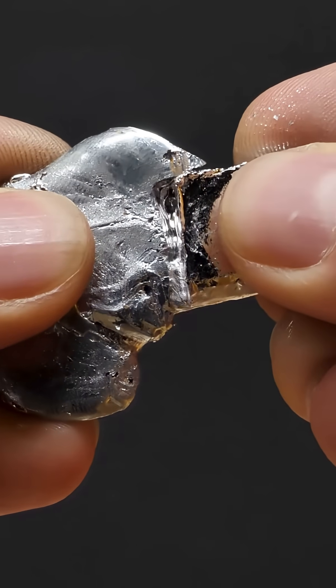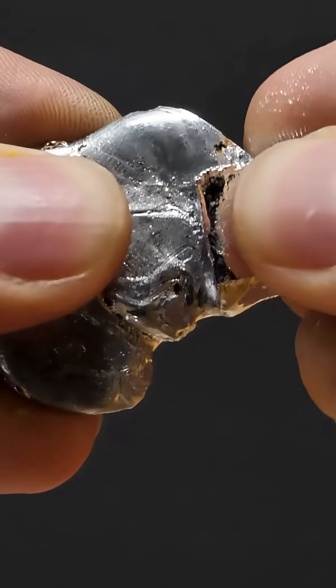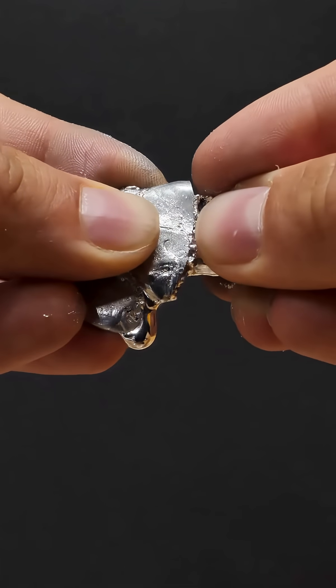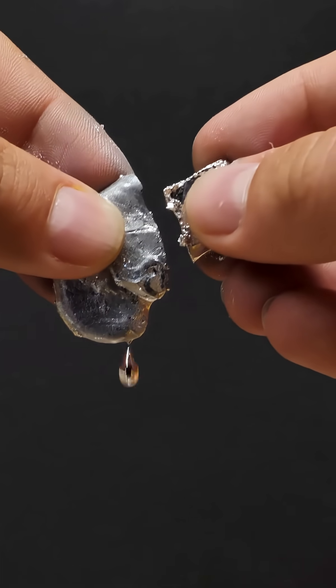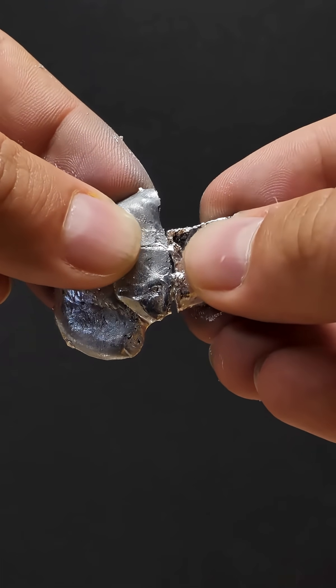The alloy can be easily created by pressing indium and gallium against each other. Between the two metals, an alloy then forms. The resulting mixture of gallium and indium remains liquid. Here it's even starting to drip large liquid metal drops.